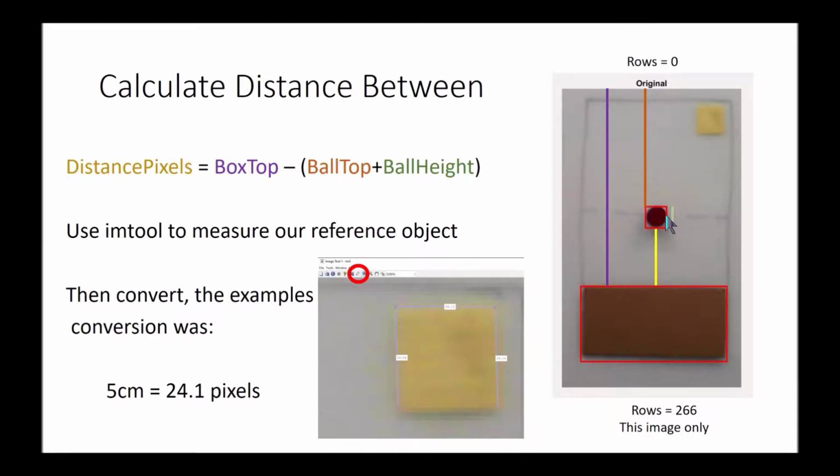I'm subtracting out the height to the top of my ball and the height of my ball. I can then convert that into centimeters by taking my reference image, which is my 5 centimeter by 5 centimeter square that was yellow in the initial image, and knowing that, I can convert that into pixels. So I can go in, measure the 24.1 and set it equal to that, and then develop my conversion from that.